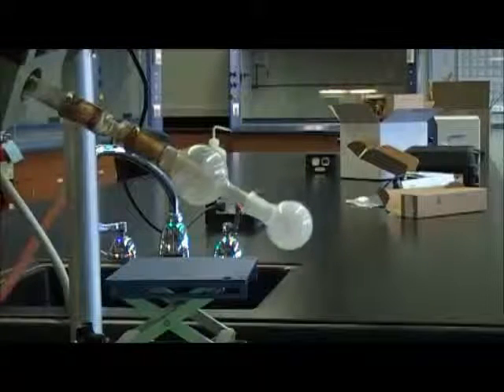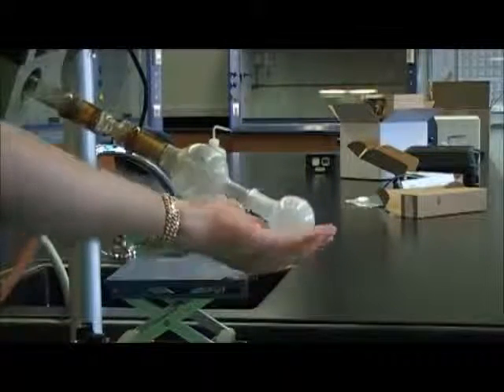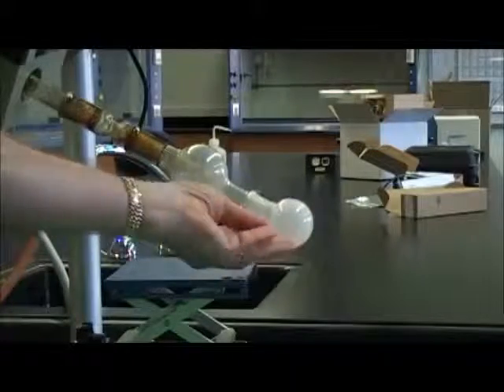And the way you know no more ether is evaporating is that either it's going dry on the inside of the glass, or you can tell because it's not getting cold any longer.